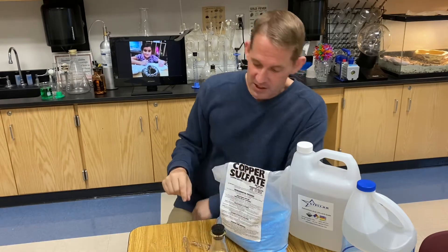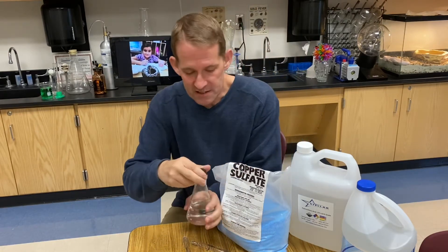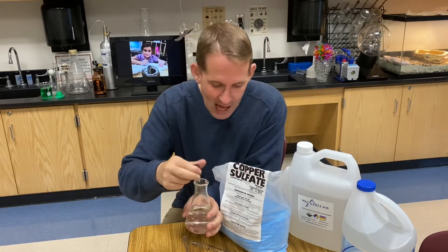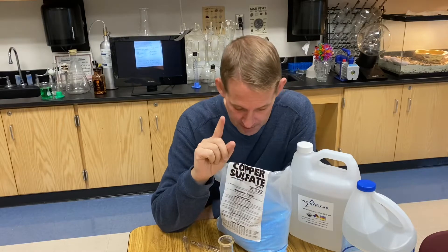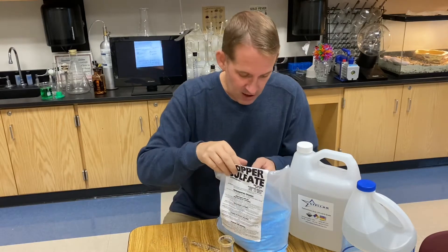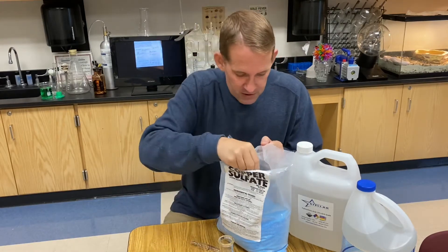Le Chatelier's principle says that when a system is at equilibrium, if it's subjected to some kind of stress or concentration change, it will shift and find a new equilibrium.